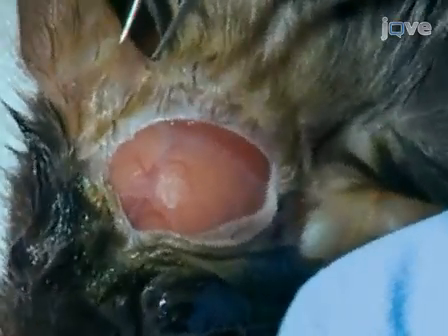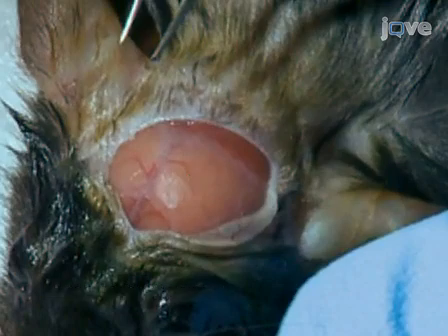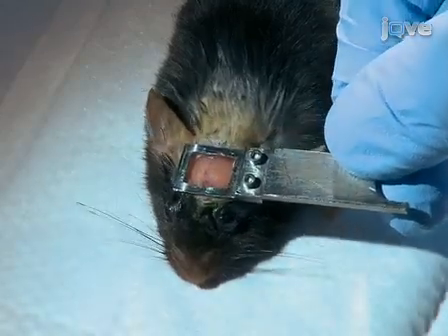Under a dissecting scope, identify the area to be thinned. Avoid areas of interest directly located over cranial sutures, as the skull is less stable in these areas, and underlying large vessels and meninges will interfere with imaging. Center the viewing window on the area of interest.